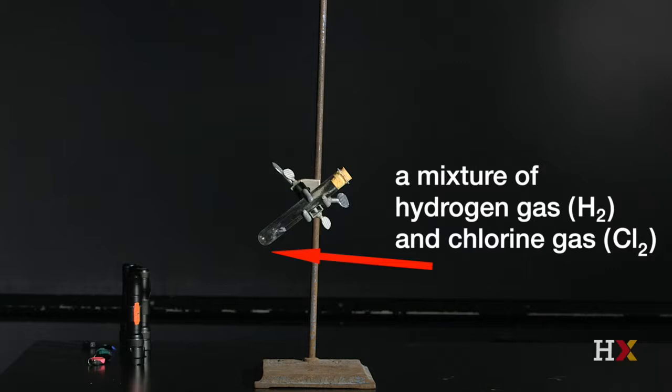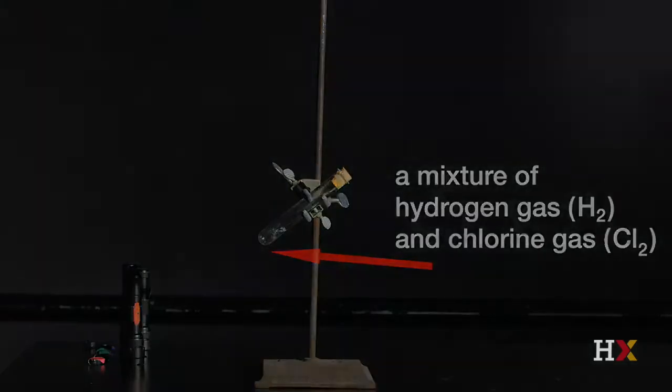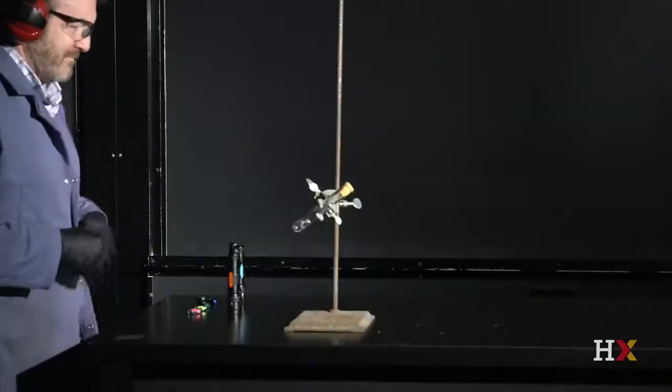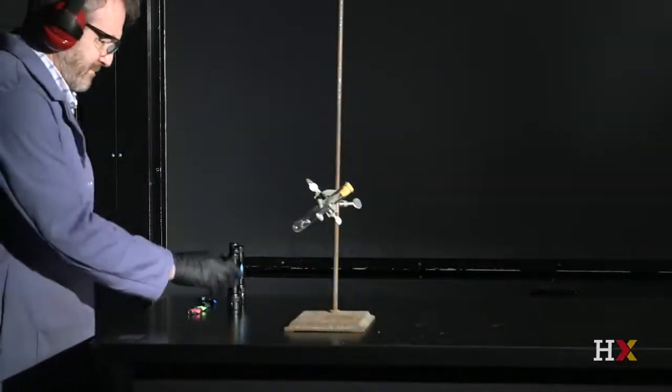We are going to try to initiate the reaction of H2 and Cl2 to form hydrochloric acid, HCl, by shining light onto the mixture. What color of light do you think is highest in energy and is most likely to initiate this reaction? Let's see what happens when we shine different colors of light on the test tube.